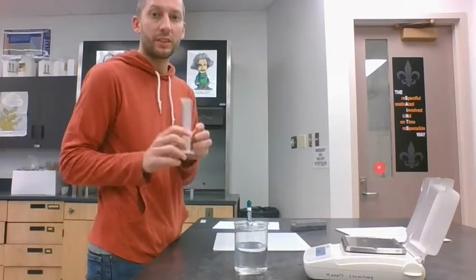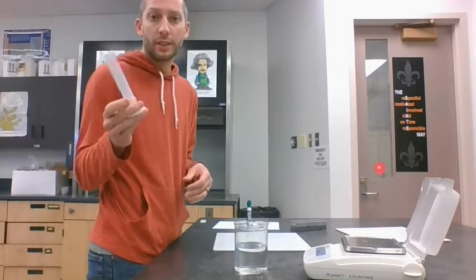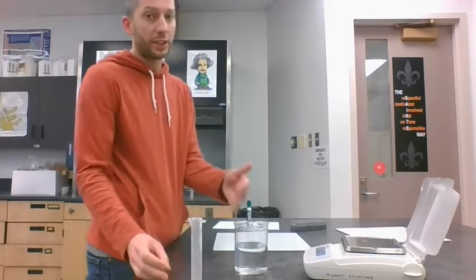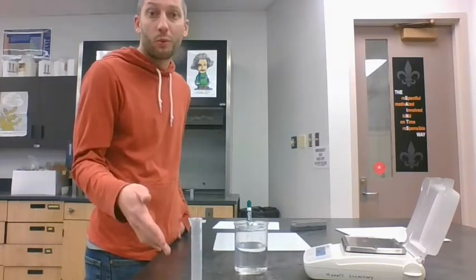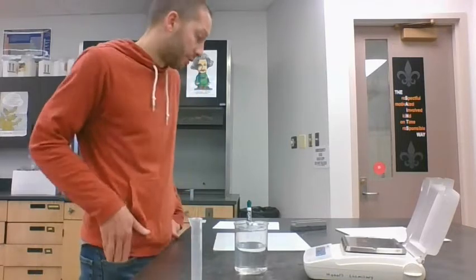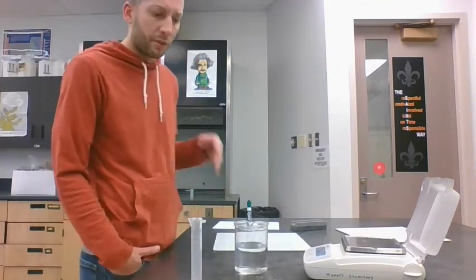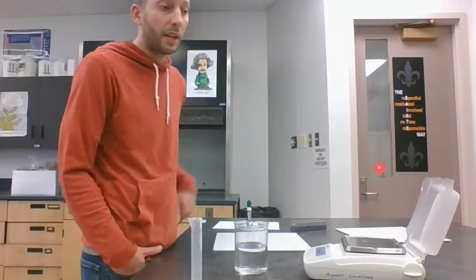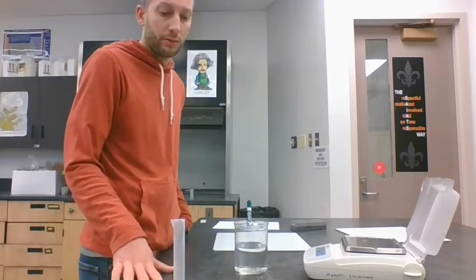We're still going to use a graduated cylinder, and I just grabbed a smaller one here. We can record the volume of water in this pretty easily. If I just pour some water in there and record the volume, we won't have to do any subtraction. So we're just going to take 4 measurements again. I'm going to pour 4 random amounts of water in there and read what the volume says, because it really doesn't matter how much. I'm just going to use a small amount so it's easier to make your graph in a second. So the volume part is pretty easy for the water.